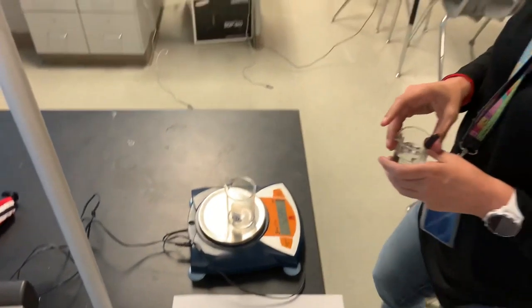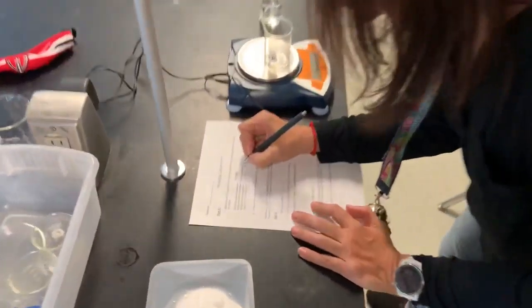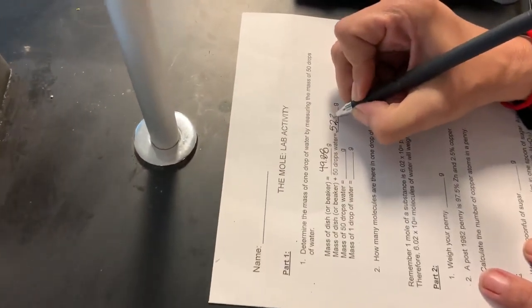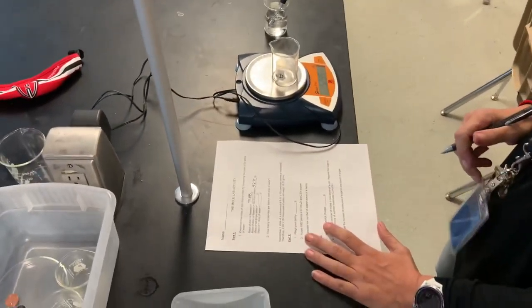Yes, all right. 52.35 grams - that is the mass of the beaker with 50 drops of water.